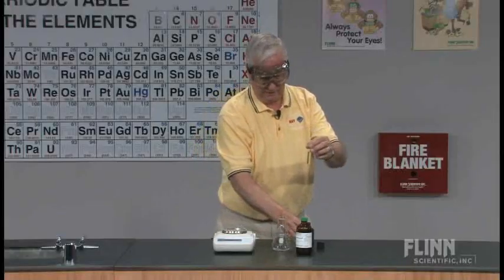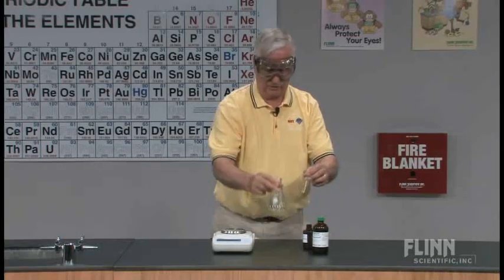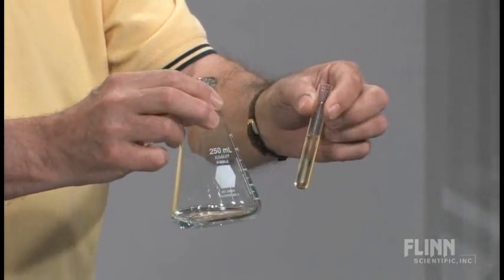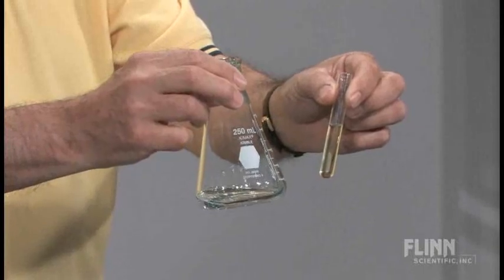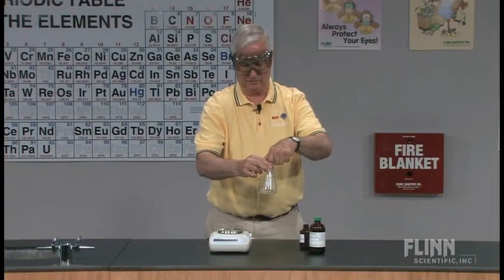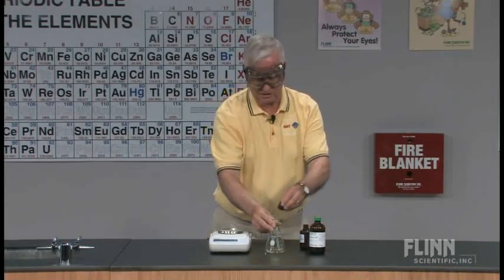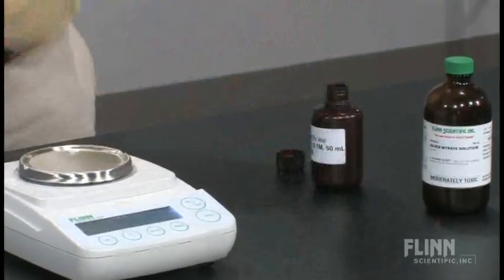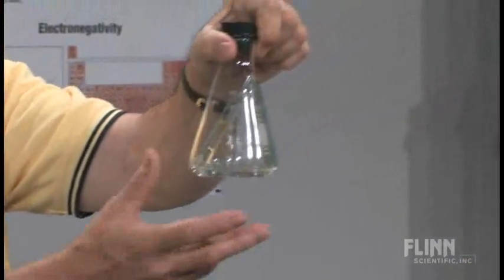Now, with careful observation, we notice that the silver nitrate solution is perfectly clear and colorless, and that the potassium iodide solution is slightly yellowish and clear. By very carefully placing the tube down inside the flask and leaning it, we are able to have a closed system — and that's an important factor. We put a solid stopper in the top, and we have a closed system. This system is going to be our reaction vessel.